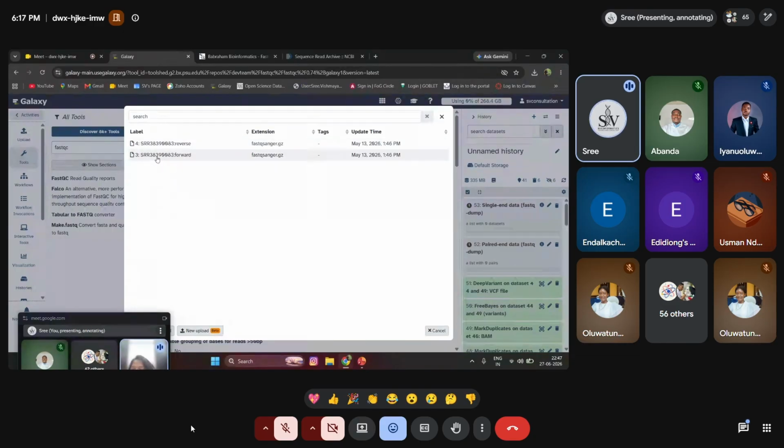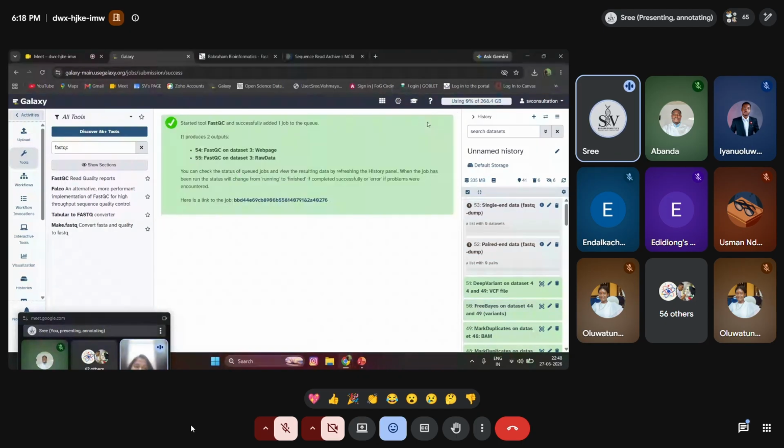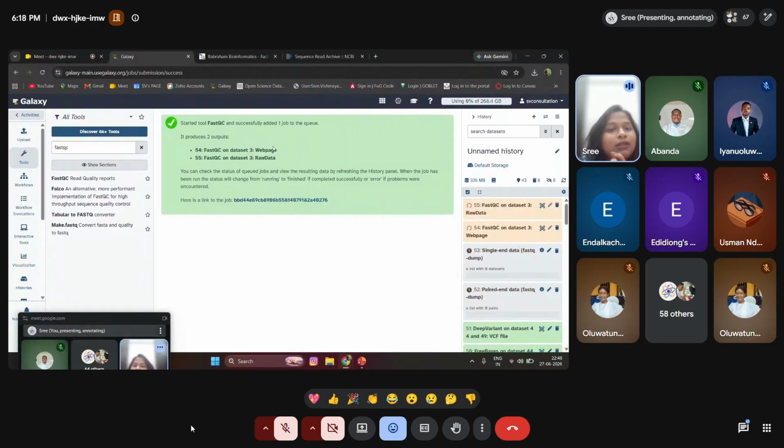I have selected one data, which is the SRR ID of this. I'm just selecting the forward strand. I'm not doing anything else. I'm just running a FastQC quality check. You can see the quality check processing taking place over here. Once the quality check has been done, it will provide the web page HTML report.